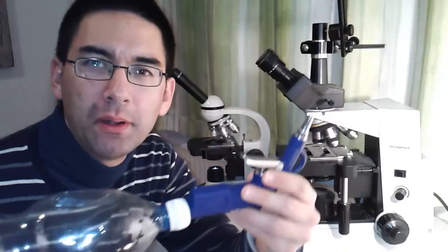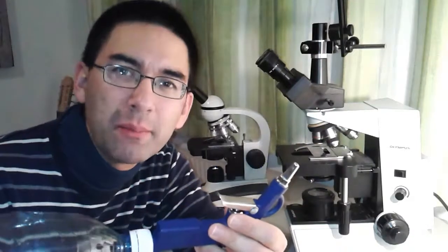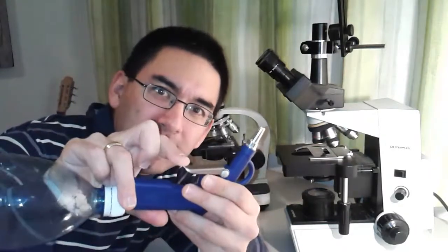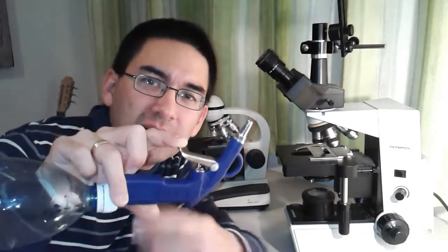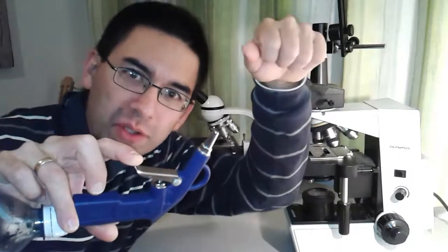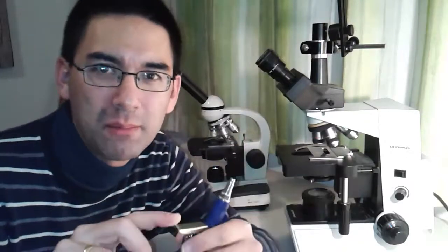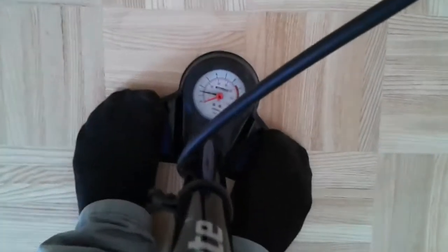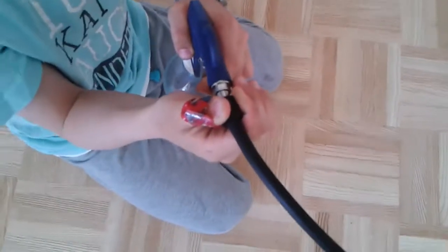Now, pumping up the bottle is also a little bit difficult, because you have to do two things at the same time. You have to pump it up by pressing down the piston of the bicycle pump, and at the same time you have to open the valve here to allow the air to go in. Then you have to close it again, and pull up the bicycle pump again, and when you compress the air again, you have to open the valve again. So you have to coordinate two movements at the same time. I don't want to put in much more than a bar and a half, because I don't know whether the bottle is going to explode or not. Okay, I think that's enough.